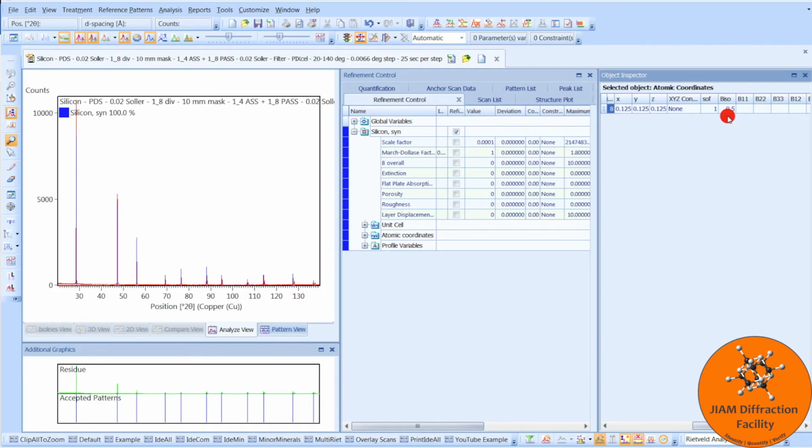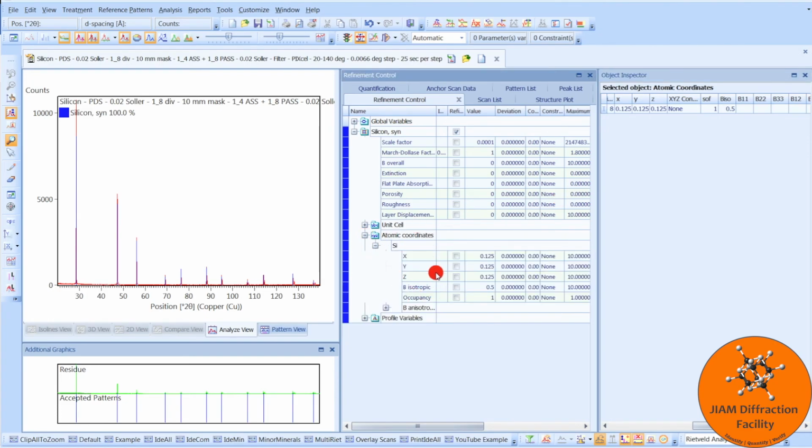I know in GSAS, which is another refinement software, it uses U values instead of B values, and a U value of 0.02 seems to work well for GSAS, and that translates into a B value of about 1.5, if I'm not mistaken. So you can try that. It seems that in a lot of CIF files I have looked into, if they aren't really sure what value they should be using for B, they tend to use 0.5 as a default value, so you could try that as well.